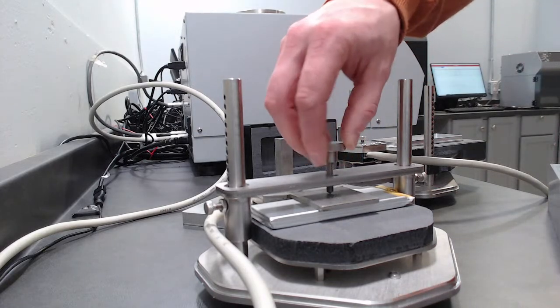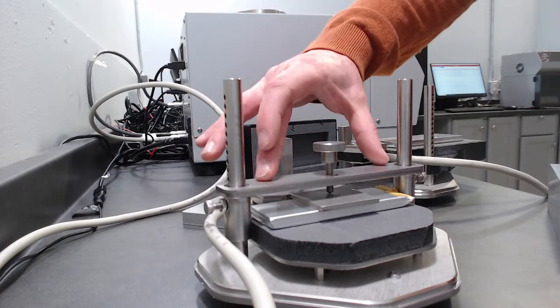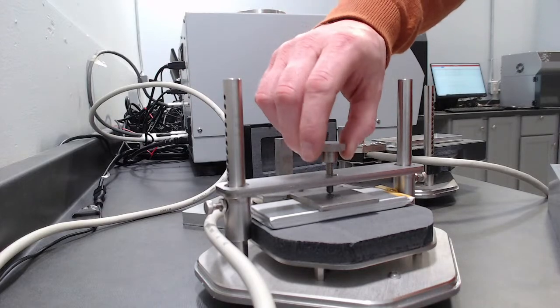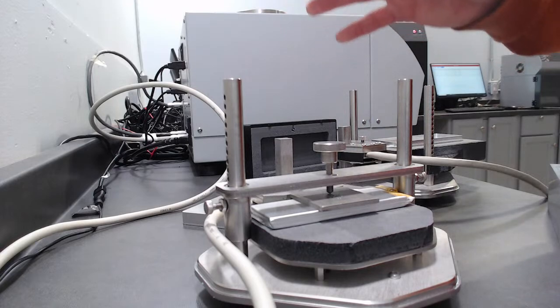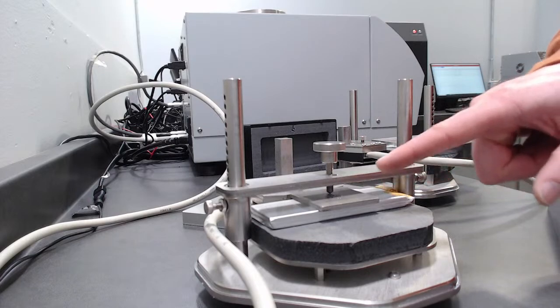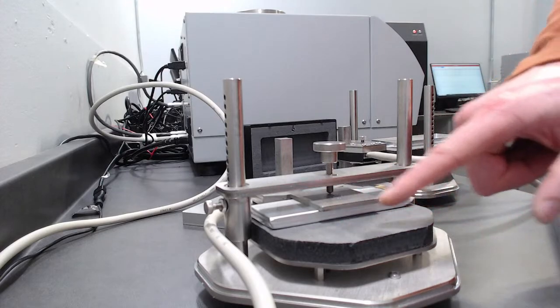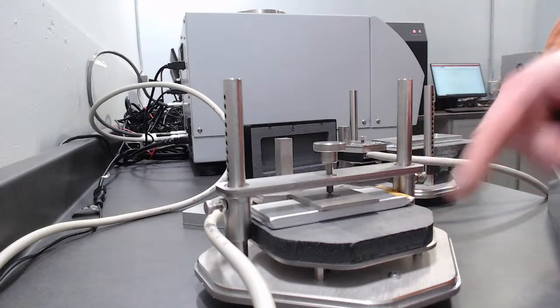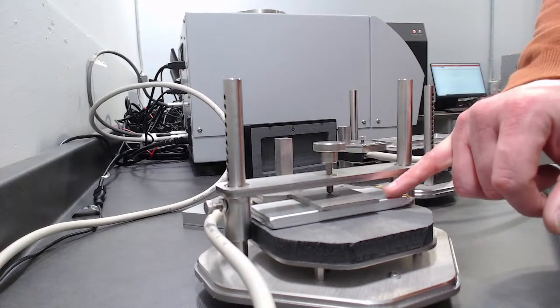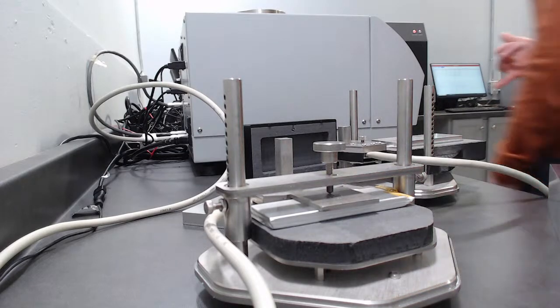Some of the questions we get when we're measuring batteries is, can we change the pressure? Of course. If you were to take this top bar off, you can use different weights to accomplish that, or we even have compression stands that allow you to precisely measure how much pressure you're applying. So that's a single-sided setup for a pouch, an anisotropic pouch cell. On the bottom is our XPS. That becomes a known material because we've measured it. We can input that value in the software, and then our sensor, and then our pouch sample. So that's the setup for a single-sided pouch test for measuring directions.